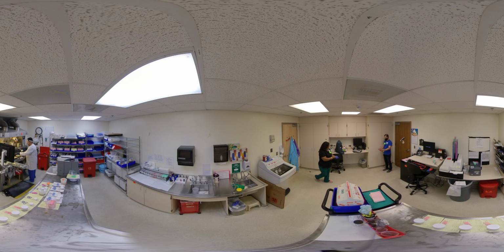Number 1 is, of course, accessioning. Even though this is a very important step, for now, you should just know that accessioning generates a number specific to that patient's sample. Now let's take a look at the second area called grossing.